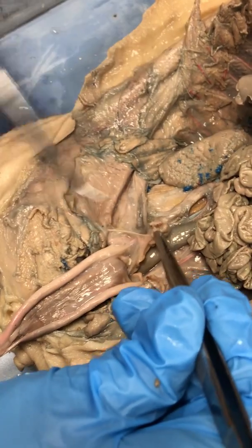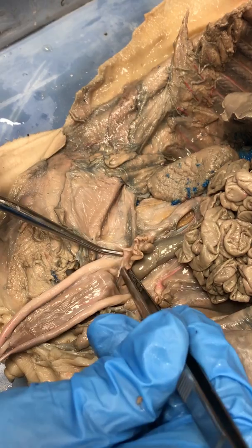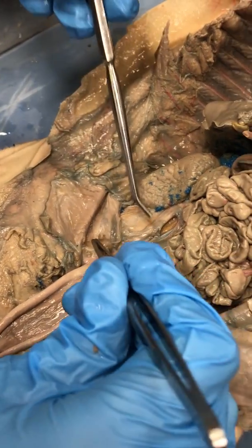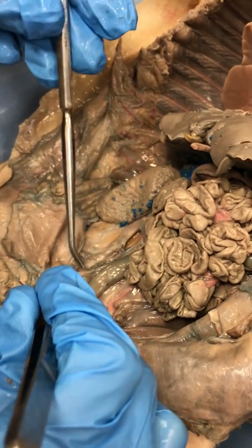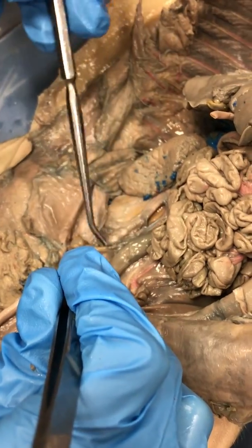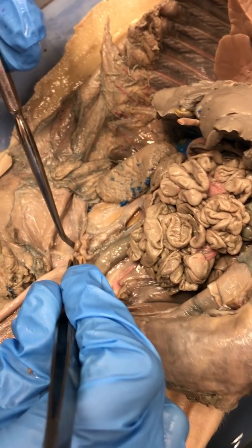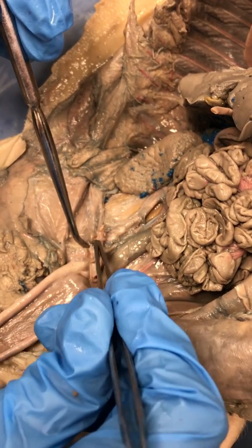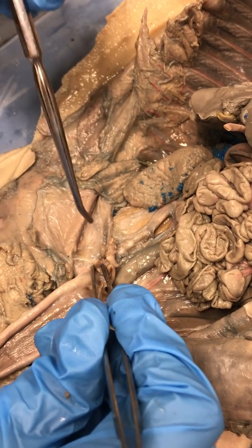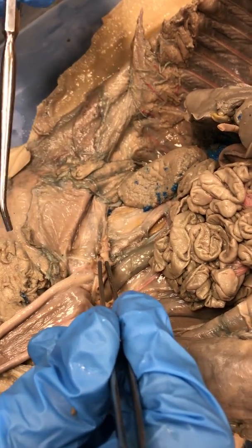Finishing out your female reproductive anatomy, you've got a ligament that holds your uterus against the body wall. That's called the broad ligament. You've got a ligament that suspends your uterus or your ovary into the abdominal cavity. That's called the suspensory ligament. And then you've got a small little ligament that holds your ovary to your uterus proper. That is called your ovarian ligament. And even though this is tiny, you can see all of these really well on this pig.